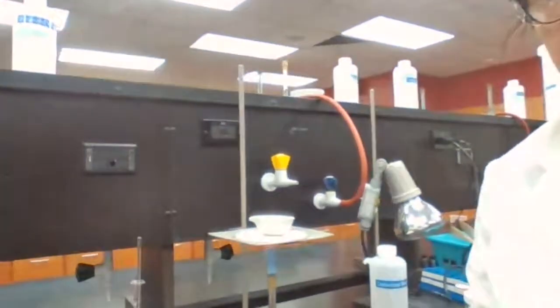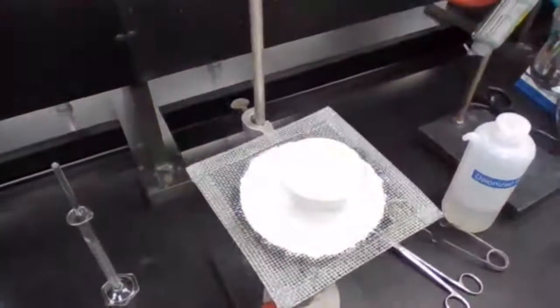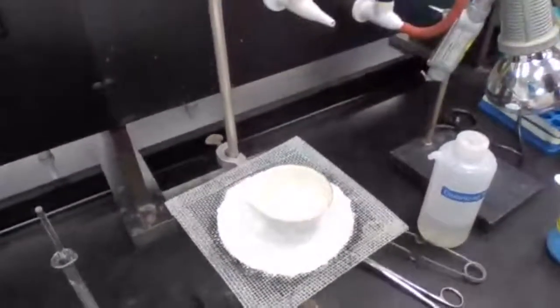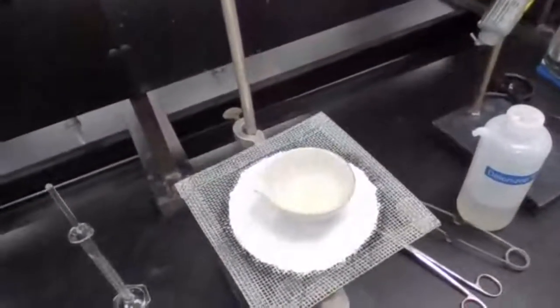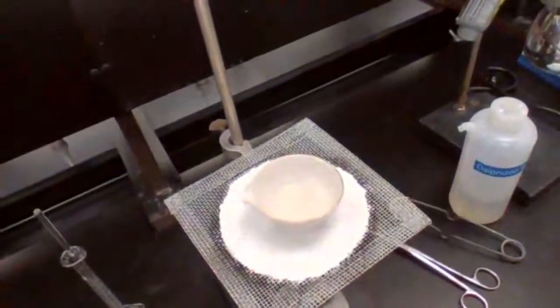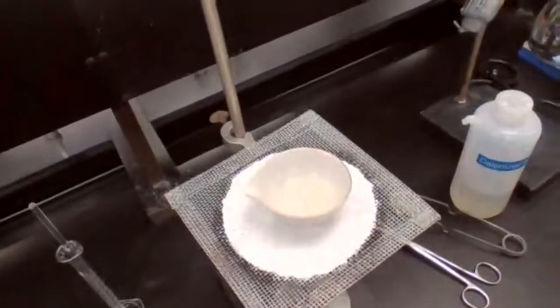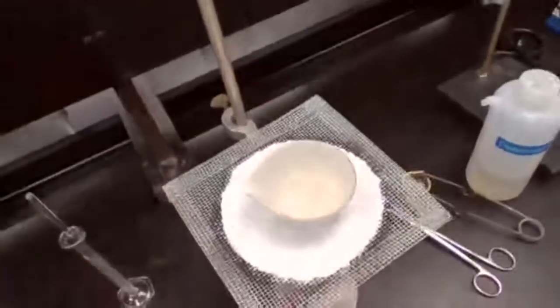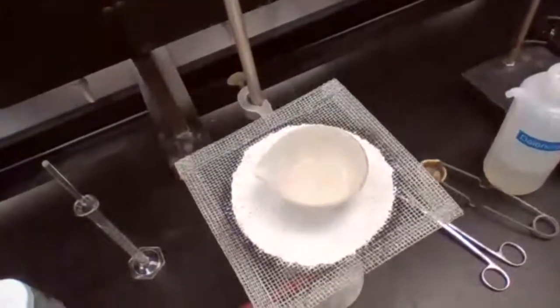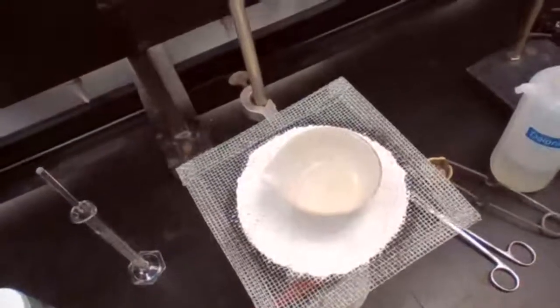Okay, so you probably want to know what's going on. Almost there, and it just needs maybe a couple more minutes to dry up completely. When it gets low, drying out happens quickly because it's very concentrated at this point, because you have all of your zinc iodide in that small volume of solvent. So it's very concentrated. It's a thick solution at this point.